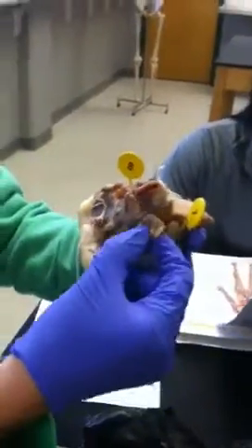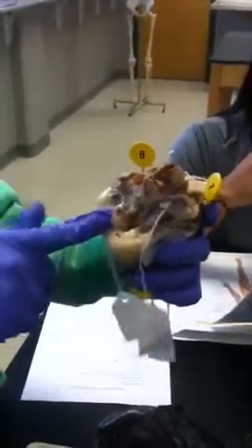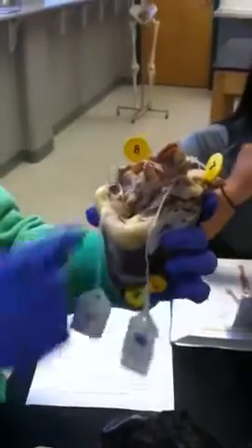If you're looking at it on the posterior view, the superior is right in front of the aorta, so it's right here. And then the inferior vena cava is to the left of that if you're looking at the posterior side, so it's right there.